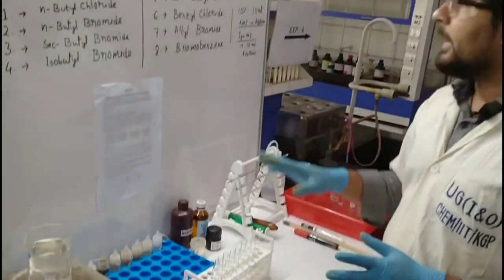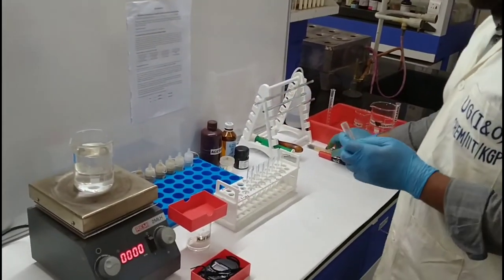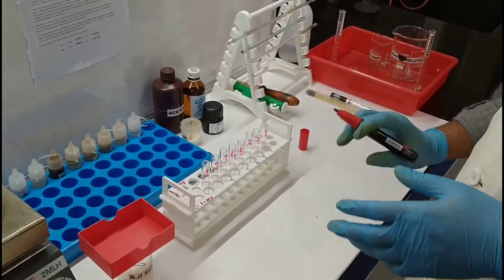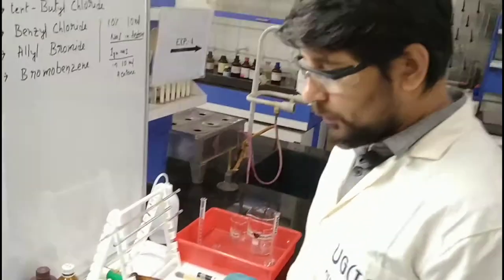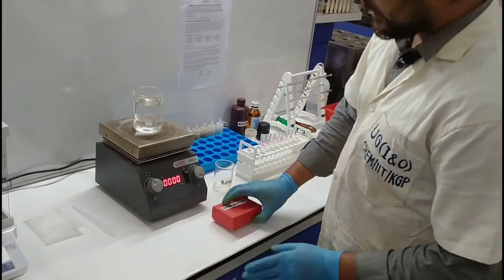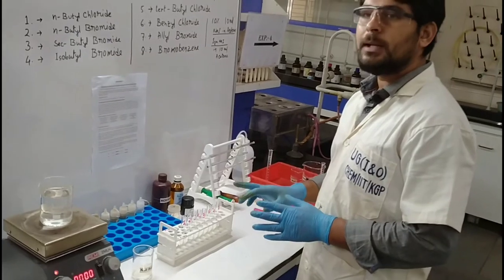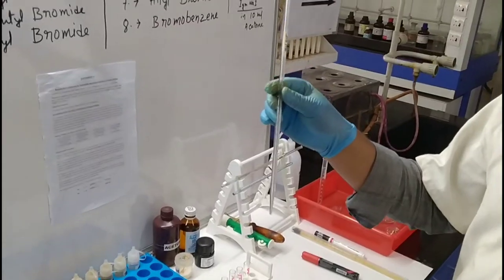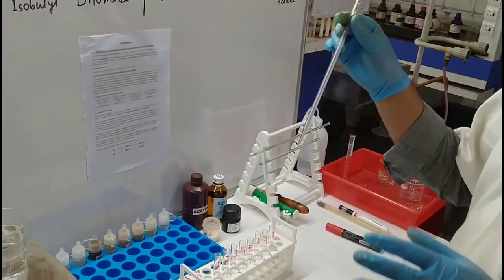For 8 halides, 8 test tubes are required. These are the 8 test tubes. I am going to label the test tubes 1 through 8. Now labeling is completed. We have to transfer the prepared NaI solution into each test tube — 0.5 ml. Using this pipette, we can measure 0.5 ml of NaI.